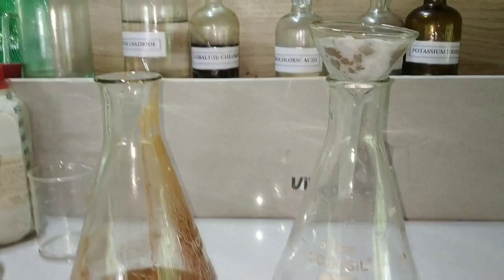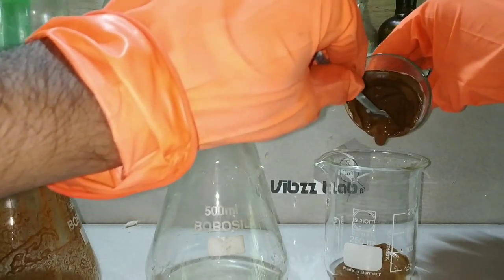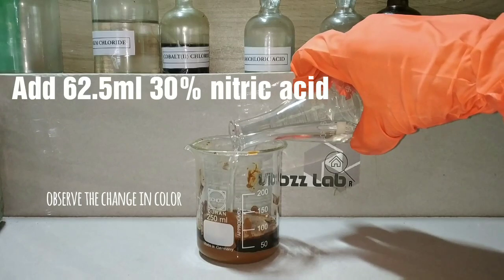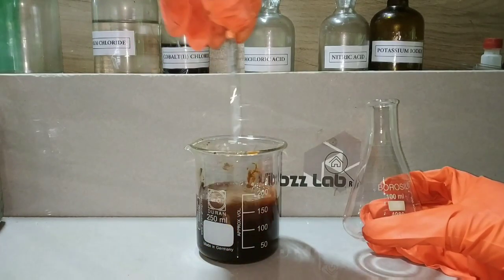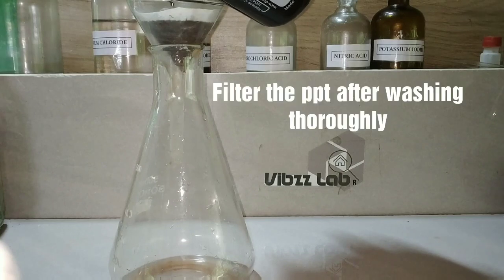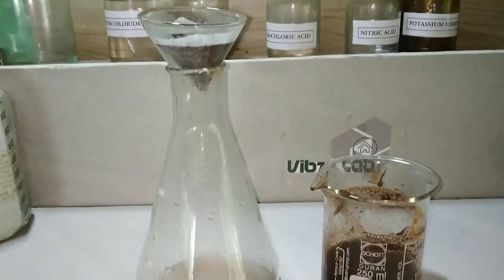I can't specifically say that only one oxide is present in it, so our next aim is to convert all the oxides into lead 4 oxide. I transfer this brown colored precipitate into a beaker and add 62.5 ml of 30% nitric acid. You can observe very clearly that on adding the nitric acid, the color has turned black. This is because nitric acid has oxidized all the oxides of lead into lead 4 oxide. We do thorough stirring so that all the oxides will react with the acid. We boil the contents for about 10 minutes so that all the nitric acid will react. The primary aim of adding the nitric acid was to dissolve the unreacted lead hydroxide, other oxides of lead, calcium hydroxide, and calcium carbonate present in the bleaching powder. After boiling the contents and rinsing them thoroughly, we filter the precipitate.